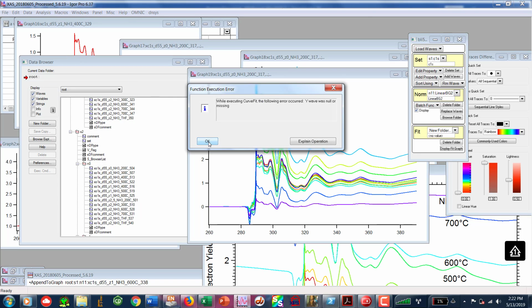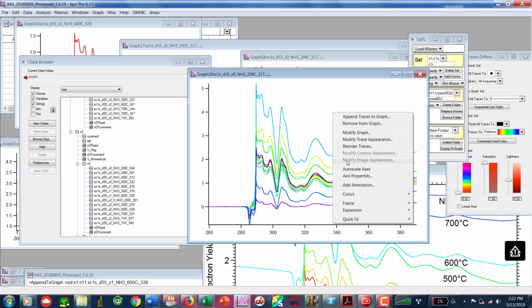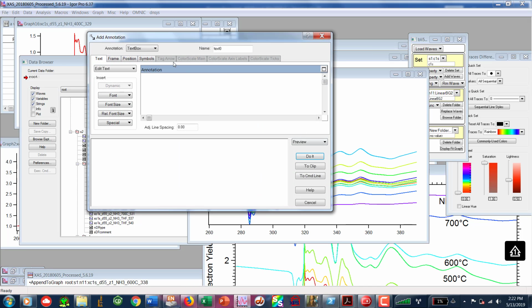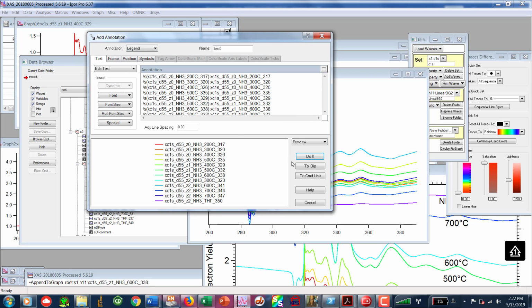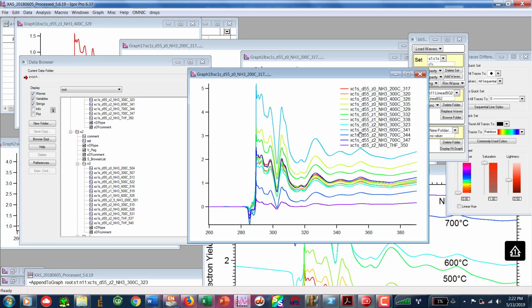And it gave us some little function execution error, Y wave was null or missing. But you'll notice once we've done that, and these are that high-res set of scans, and you can see that those are all in the 300, similar to what you had plotted previously, that we've got all of the background properly subtracted, and it looks pretty good. And the next thing would be to do the atomic normalization.